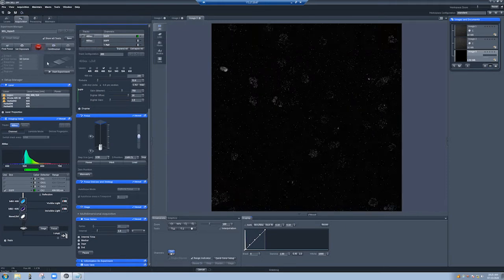So how do we keep track of whether something's bleaching? The way we're going to do this is live imaging. I'll do it over 30 cycles, so that'll be a total of 29 seconds. That'll give me enough time to draw a little box here, similar to what we do in the histogram mode, but it will generate a different graph that shows me the intensity of the pixel values in here as a function of time. And if there's significant bleaching, that will be going down. If there's not, it'll just be oscillating. So let's try that out.